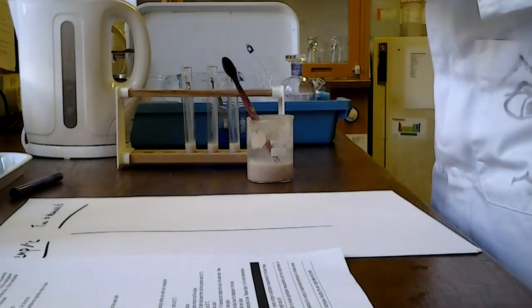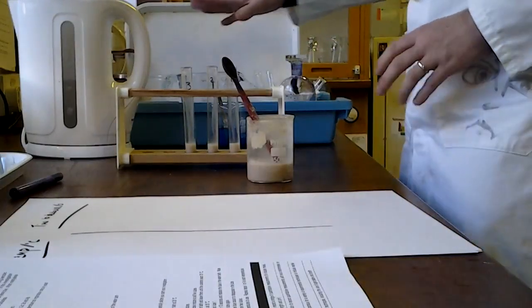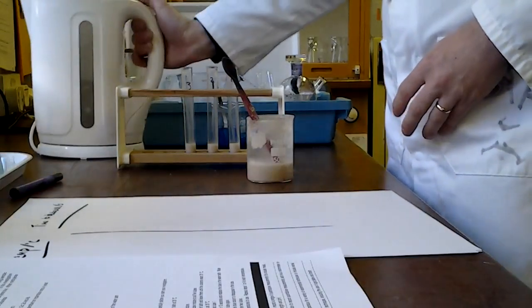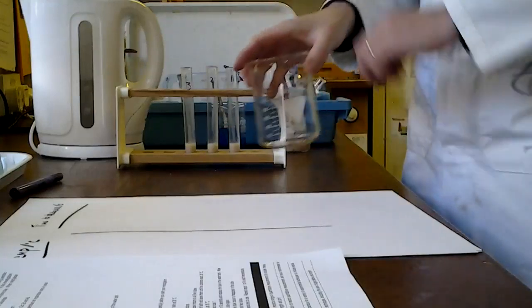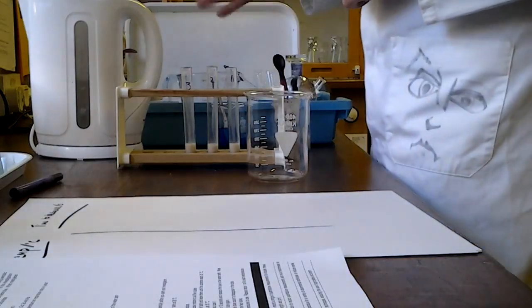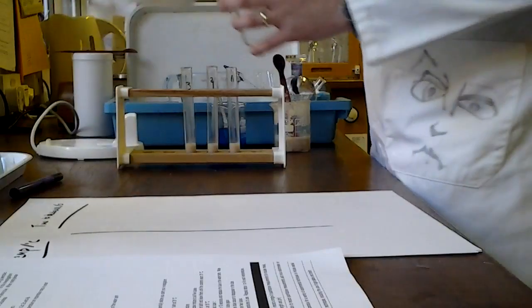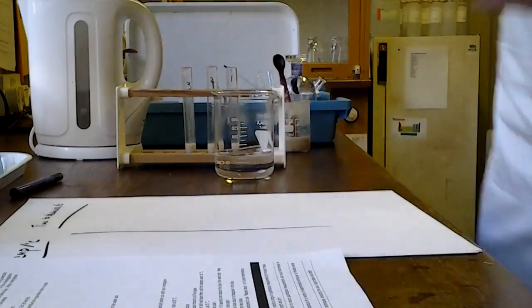Okay. And now what we need to do is we need to get those respiring organisms up to the right temperature. So I'm going to be using a kettle for this, but given that my starting temperature I'm going to be using is 35 degrees, I probably don't need to boil it all of the way. So what I'm going to do instead is I'm just going to partially boil that, and I did that a moment ago. It's now sat there kind of lukewarm, and I'm going to use a combination of that and some cold water to get my water bath at the right temperature. So there we go, there's my warm water.